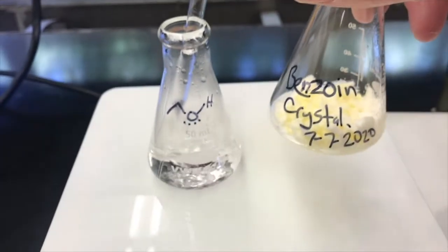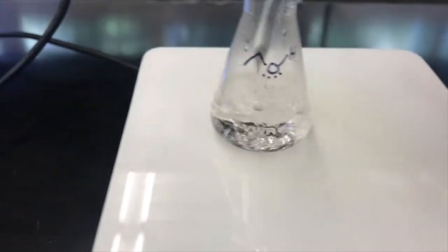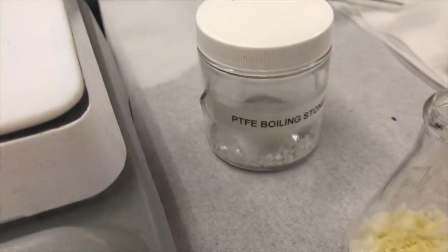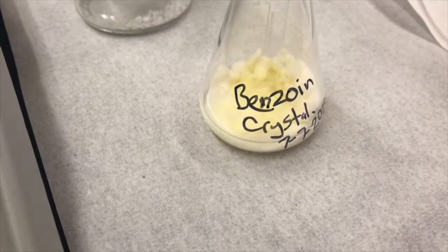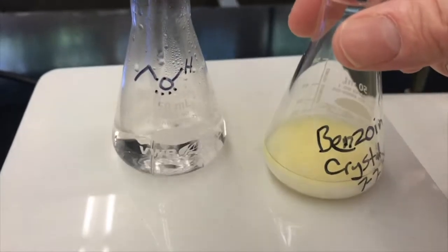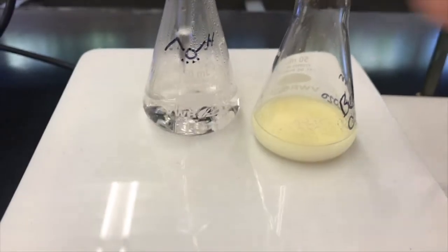I don't feel like I have quite enough ethanol in it to begin with it on the hot plate. I don't want to put it on the hot plate just yet. So I'm going to add some more of this boiling ethanol before I do that to protect the solid, because the solid can get very hot if there's no solvent in it and it's on a hot plate. Let me see. I think I can now feel safe enough. I might have added more than I want even, to put it on the hot plate and see if this is going to be enough solvent to dissolve everything hot.